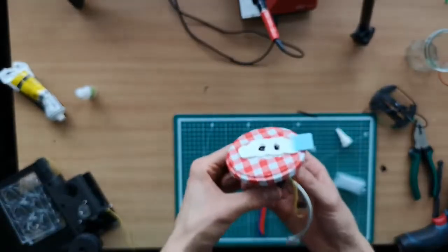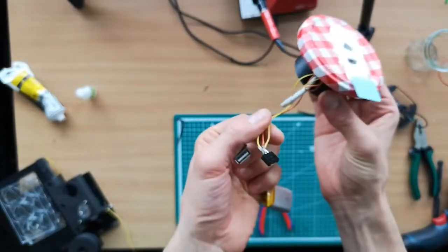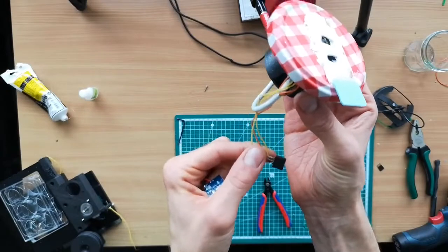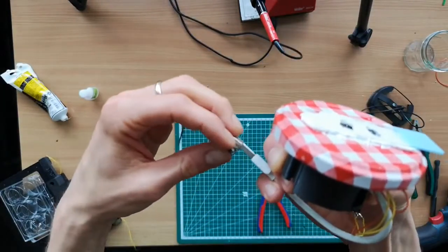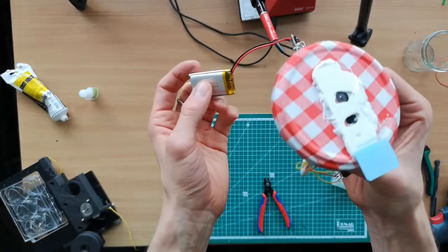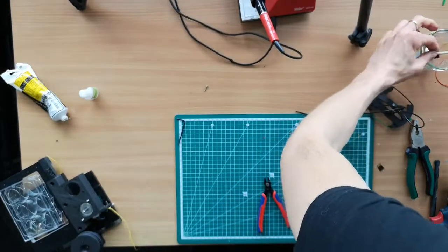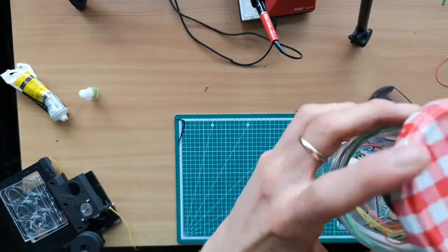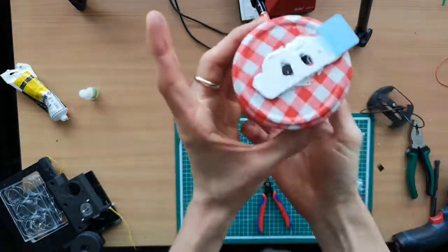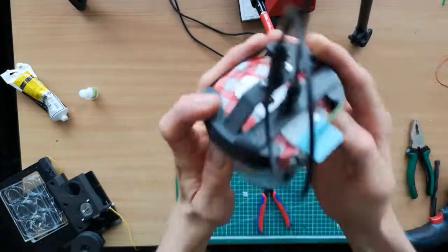And then once everything is sealed and tight, you can also wrap some tape around the transistor so that this is not creating any shortcut. You turn this on, and then you can put everything in here. And then add the illumination. And then you're done.